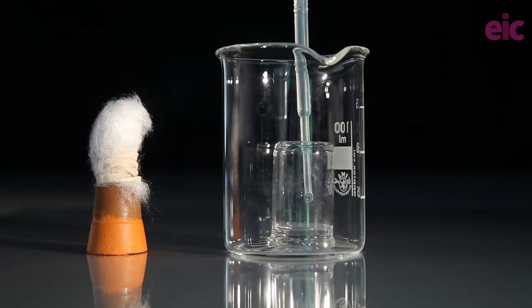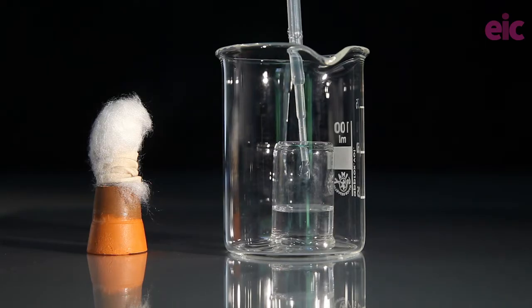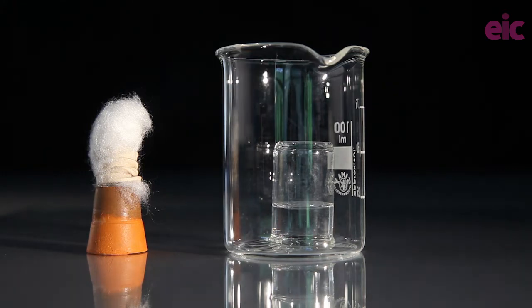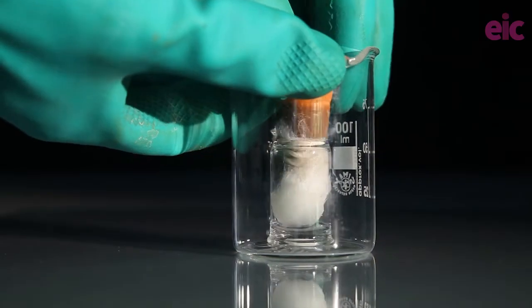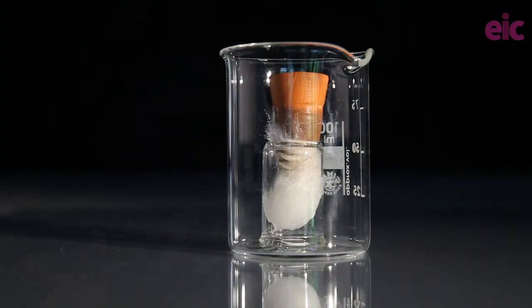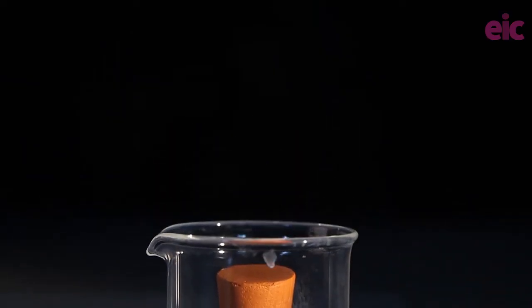Prepare up to four centimetre cubed of the liquids into sample vials which are themselves in small beakers for preventing spillages and later on for catching any drips from your tube. Keep these at least one metre apart before and during the demonstration.